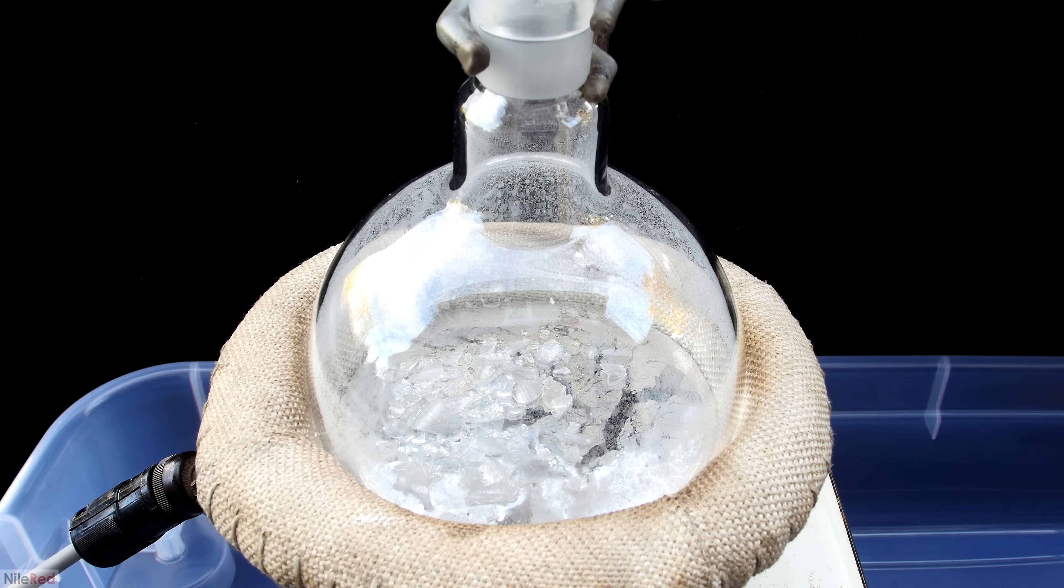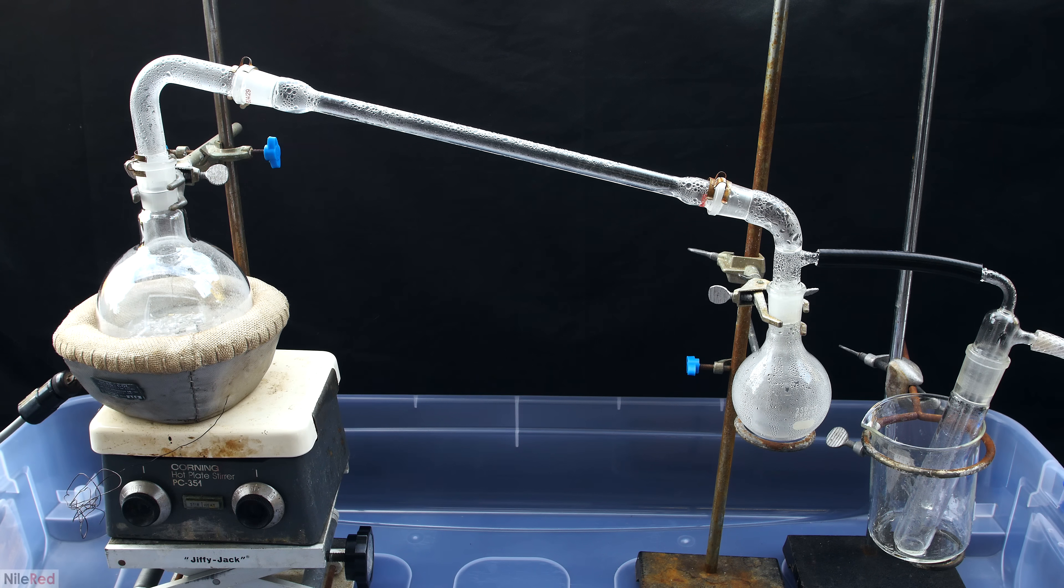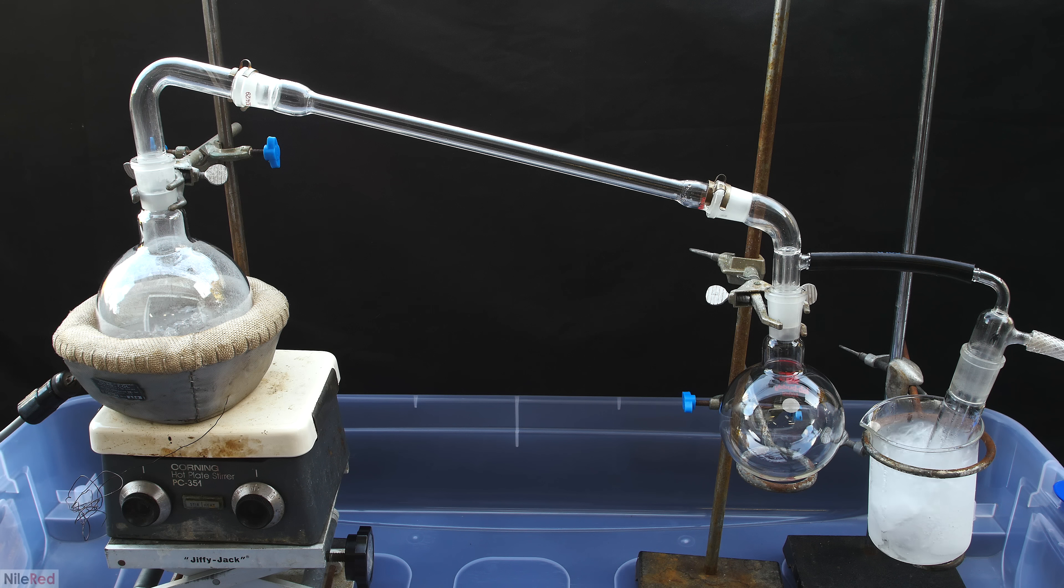Anyway, boiling off water isn't too interesting, so I'm going to jump ahead a little. I kept heating things until water stopped coming over, and it looked like there was no water vapor in the distillation flask. The vacuum pump was turned off, and the apparatus was cleaned, dried, and reassembled.